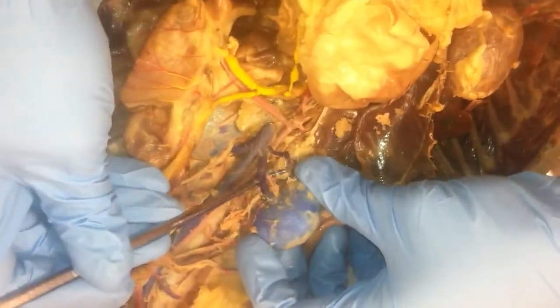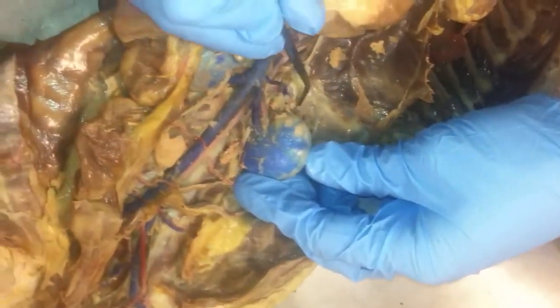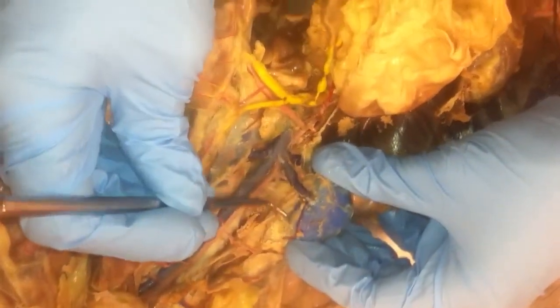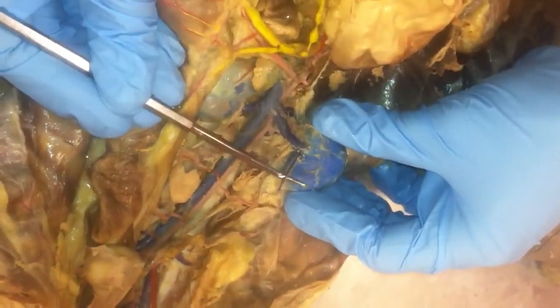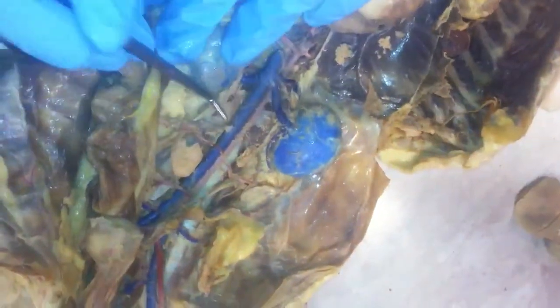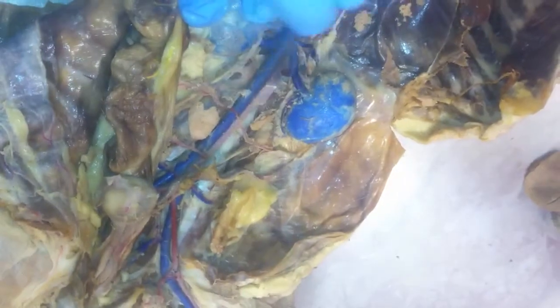And right here we have the renal artery and vein going into the center of the kidney. Adrenolumbar is different because it goes to the adrenal gland that sits on top of the kidney. Coming off of the left renal vein only would be the left genital vein. The right genital vein comes directly off the vena cava. Both of the genital arteries come directly off the aorta.